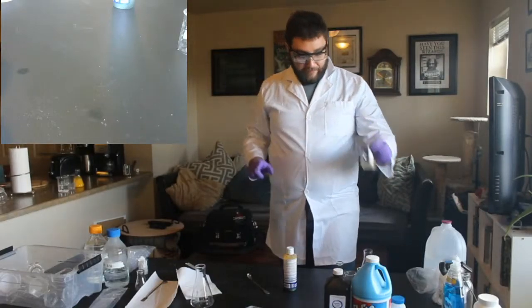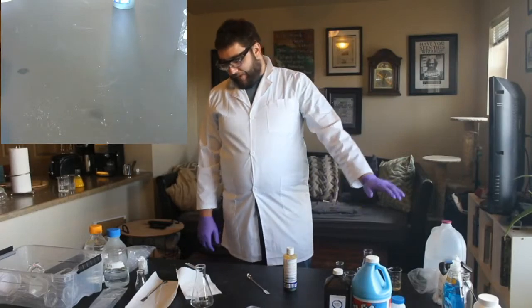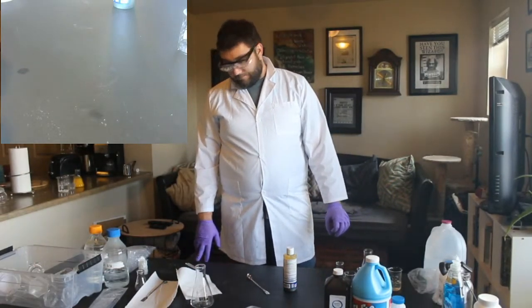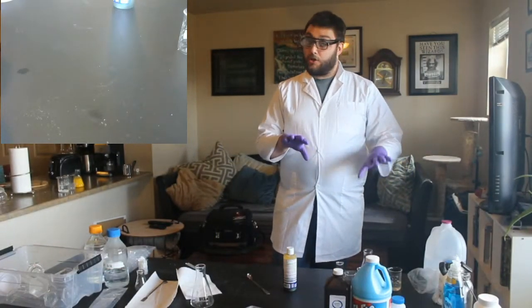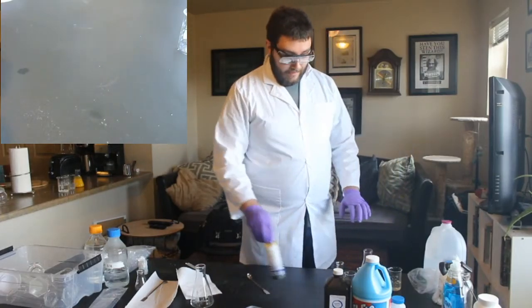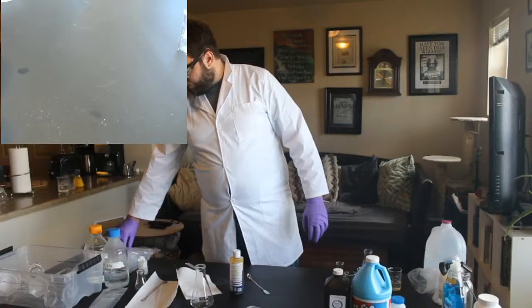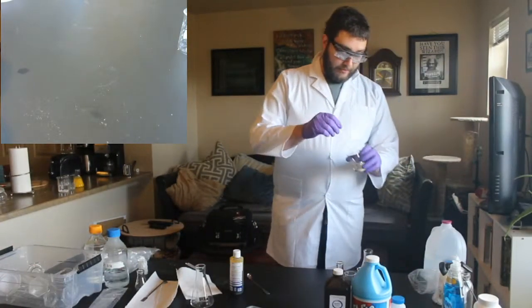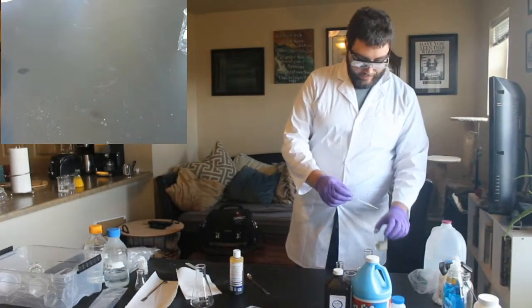So that's just our first solution. So now what we need to do is we need to combine that vitamin C with some water. That's just our first starting thing. So that's just a vitamin C. And now what we're going to do is we're going to take just a little bit of that. We don't need a lot. I'm going to use a pipetter, but you can just pour this. And I'm going to take about 2 milliliters, and I'll show you what that looks like.